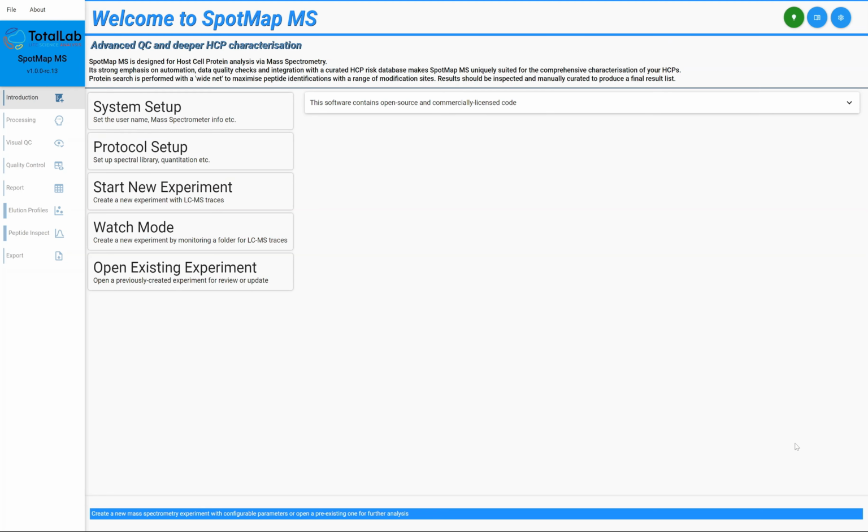Hello everyone. Today I'm going to be guiding you through the Visual QC functionality that we've got built directly into our SpotMap MS software. The quality of the data that you're getting out of our software is paramount to us here at Total Lab, and that's why we've built a lot of features around that. Visual QC is just one of them.